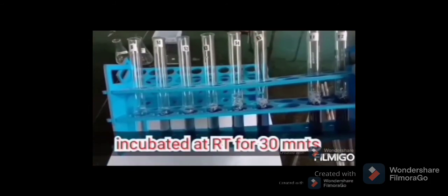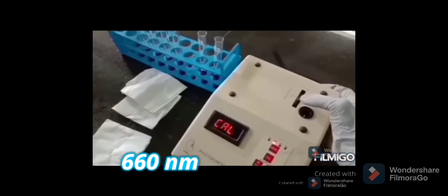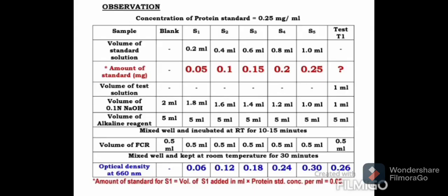Tubes are shaken well and incubated at room temperature for 30 minutes. After incubation, a deep blue color has developed as you can see, and the readings are taken at 660 nanometers.